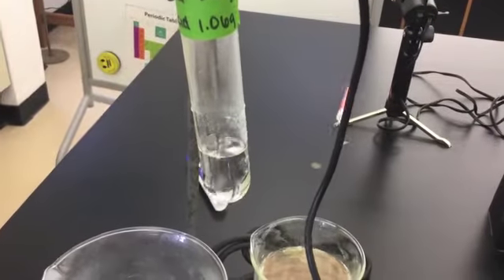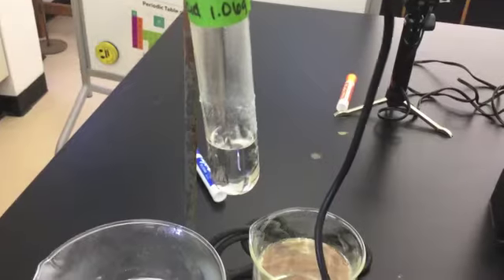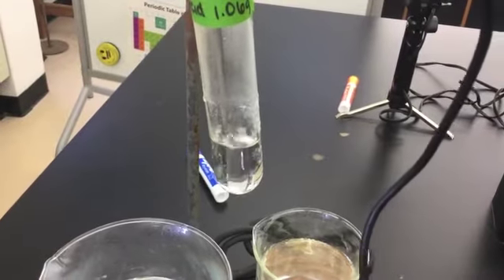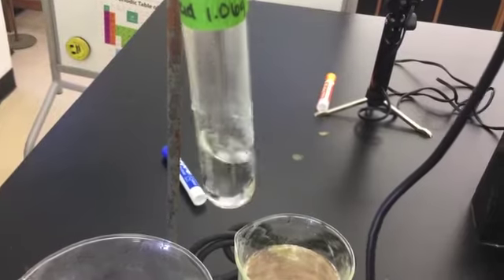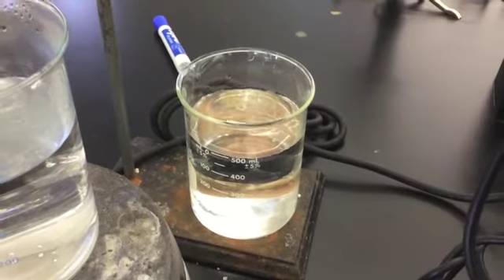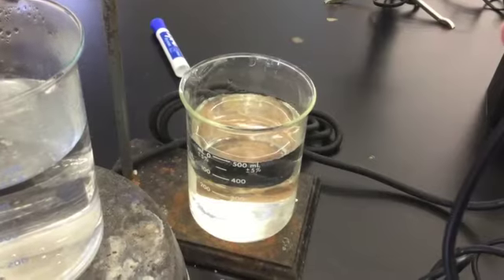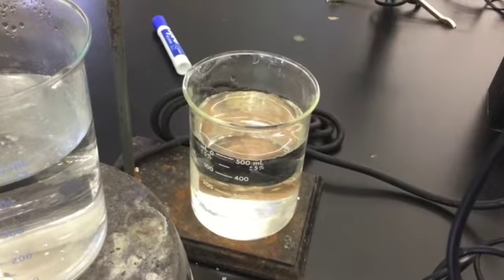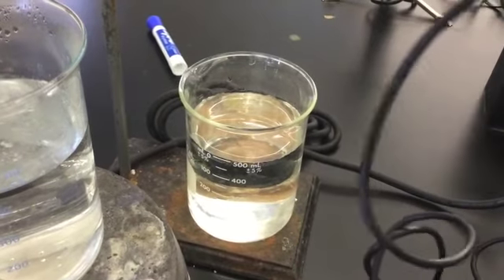Once these are stirred thoroughly, remember you need about 45 seconds for the temperature probe to equilibrate to the temperature of the liquid. Then you can immerse the test tube into a cooling water bath. Start the timer and allow the data collection to begin, all the while stirring the mixture until you have a nice long flat region with which to determine the melting point of the mixture.